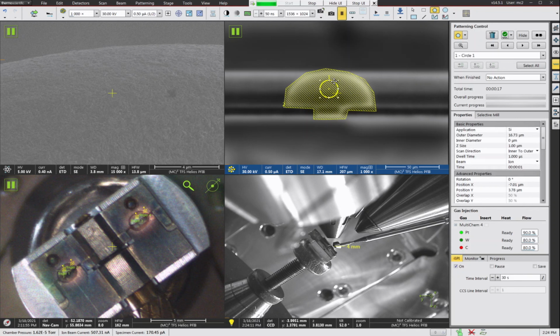And then we want to change the circle pattern in the center to be an exclusion zone. So we're going to select the circle, choose this little drop-down menu here, and say exclusion zone enable. And that will keep the FIB from cutting in the center region there. So that'll leave behind the post, and it'll cut away the rest of the material.